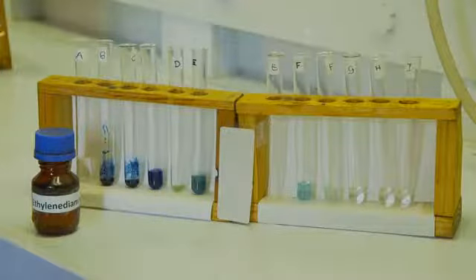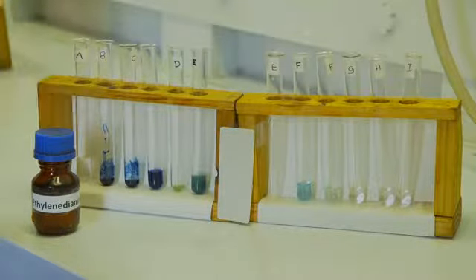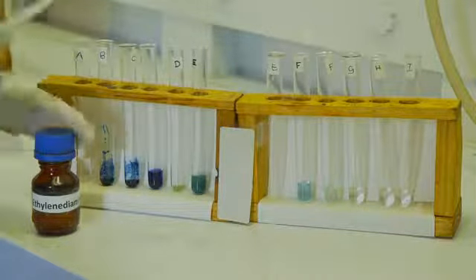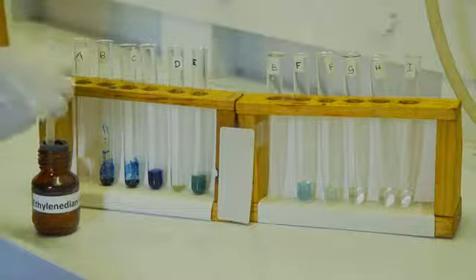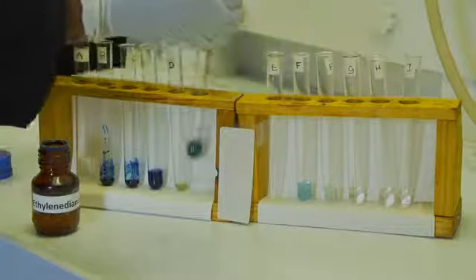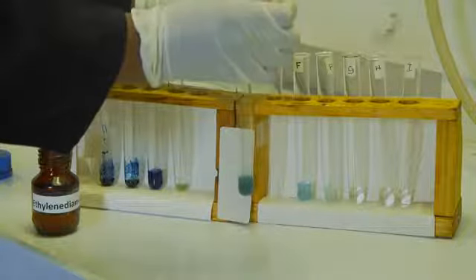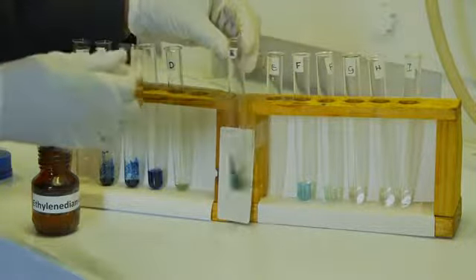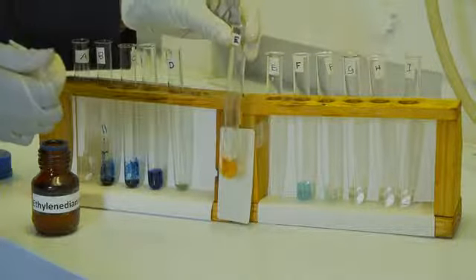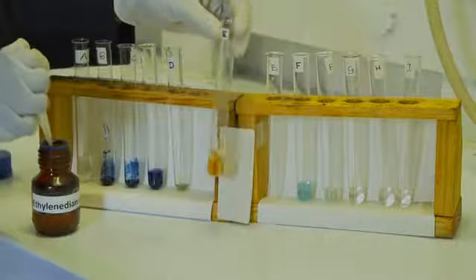To confirm the presence of cobalt 2+ cations, two separate reactions will be done in two different test tubes. In the first reaction, three to five drops of ethylenediamine will be added to the test tube suspected to contain the cobalt ammonium complex. A ligand exchange reaction will occur, indicating the formation of the cobalt ethylenediamine complex, observed by a yellow-orange color.